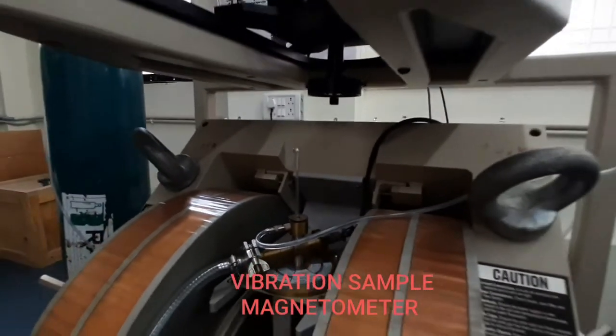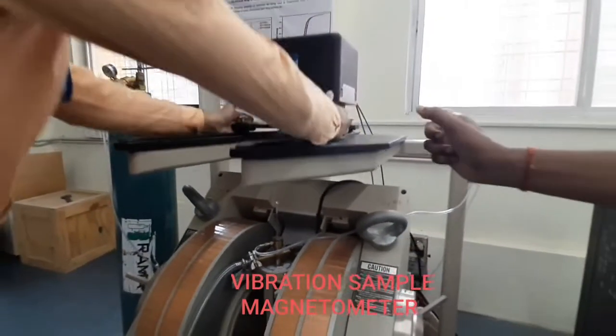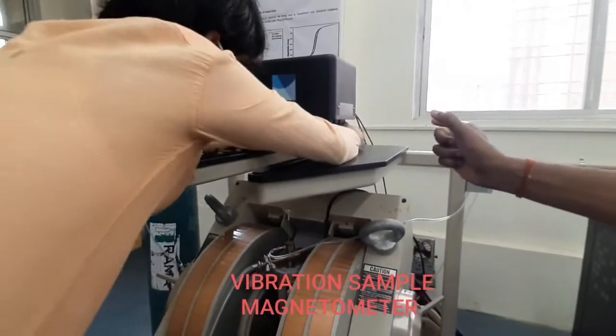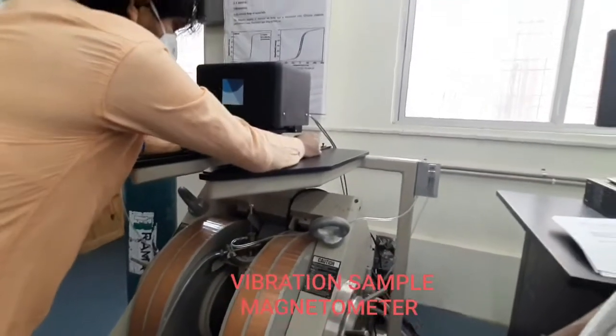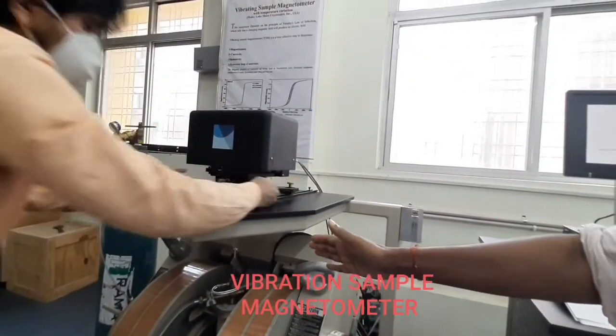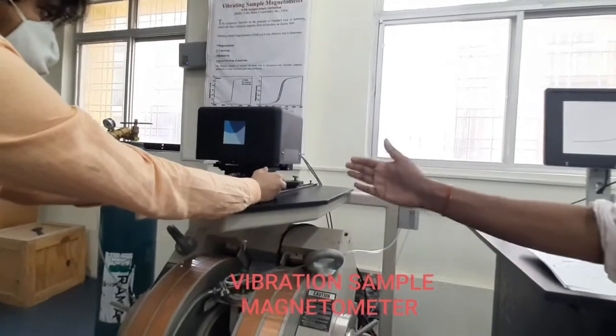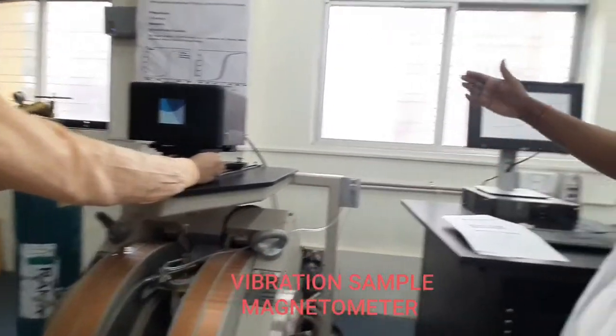Now with this sample put in, this machine is on. Now the result of this sample is seen on this screen here.